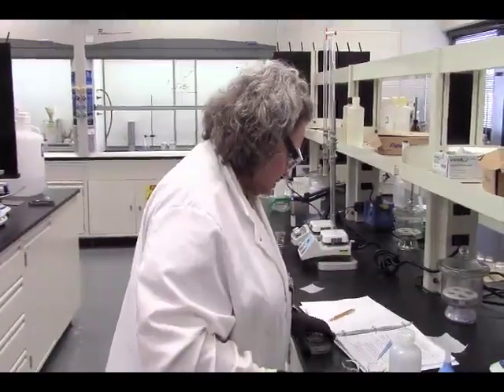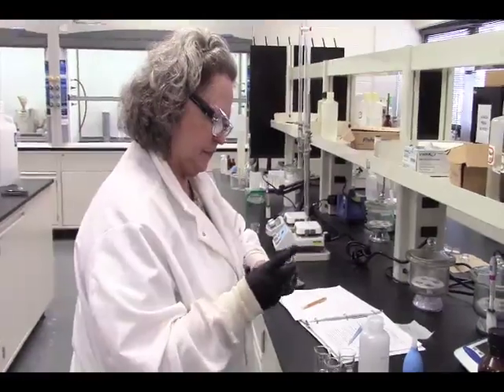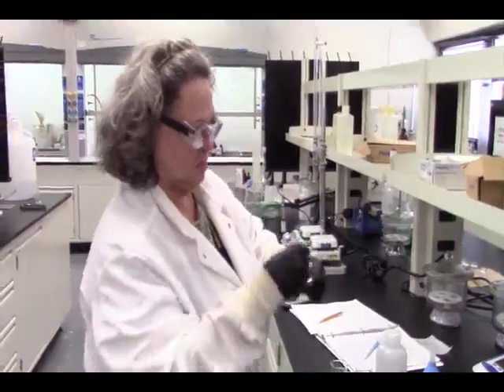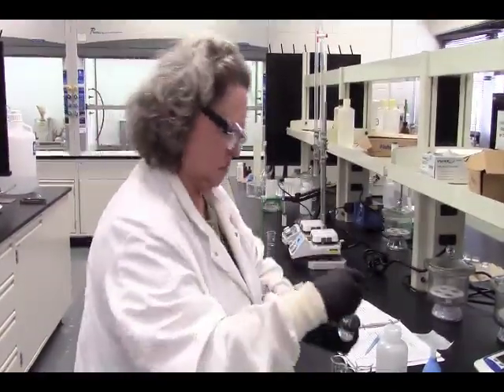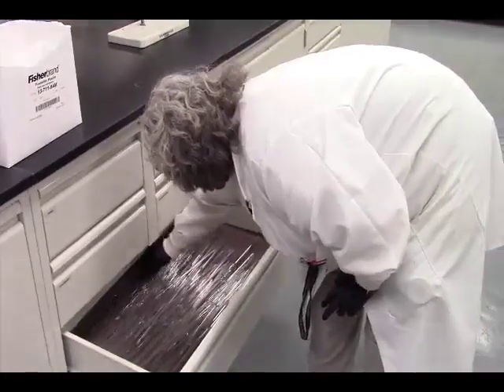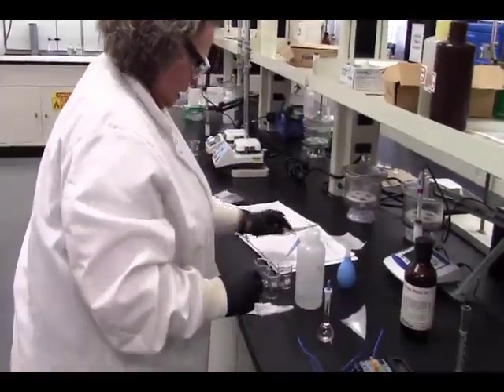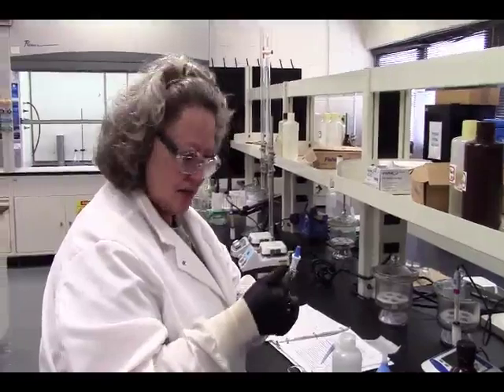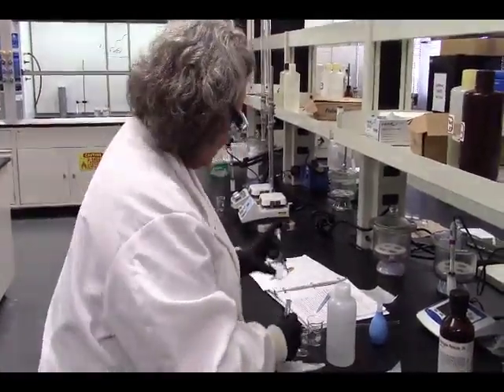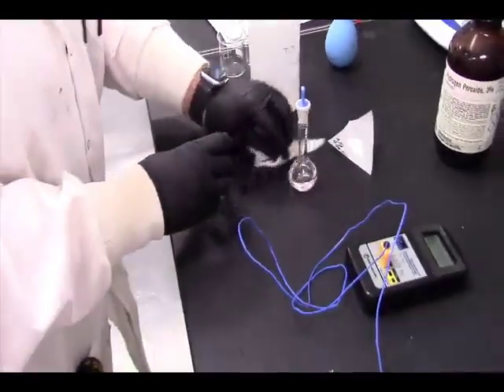All right. Now, with that stock solution, we are going to make the first complex, the glycine complex. So we need 10 milliliters of this solution. That's good. It is very difficult to get out of this, so we're going to have to transfer this to a clean 50 milliliter beaker.